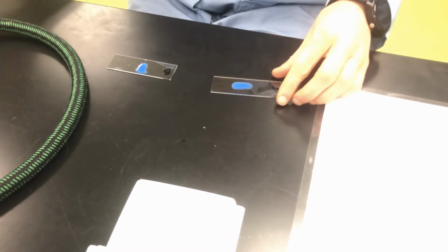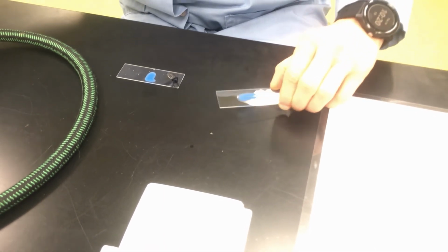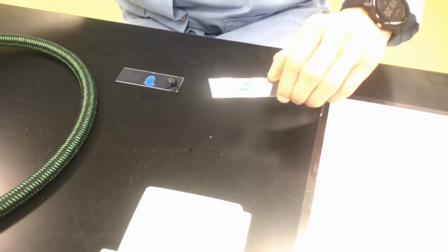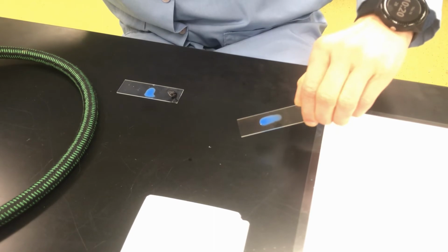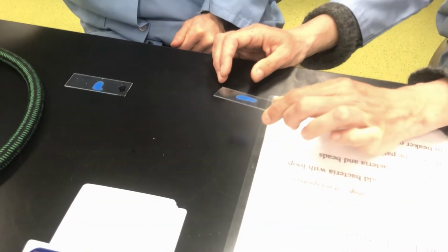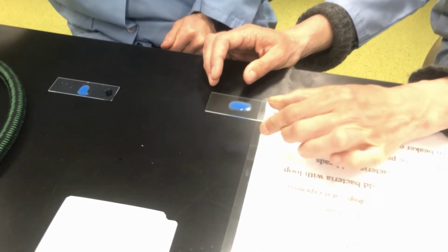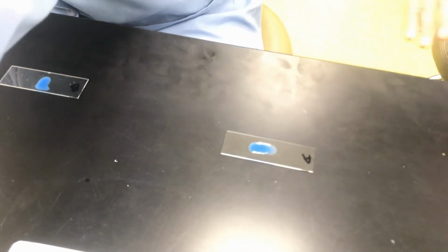And you can flame your loop. And while you're doing that, if you're able, you can just sort of gently rock the slide back and forth. Sorry, I'm asking you to do 18 things at once. Why don't I do this while you flame your loop? Thank you. I know, bossing you around. Okay. It's all good. So I'm not seeing much here, but it can be hard to know what the results are if you don't have something to compare it to. So let's hold that aside and do the same now for culture B.